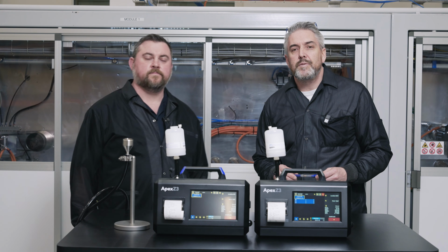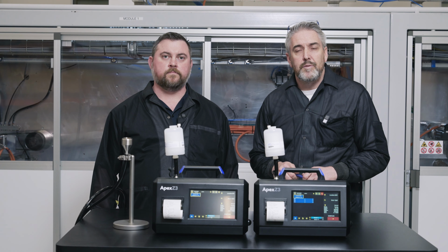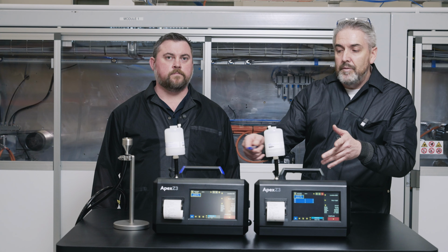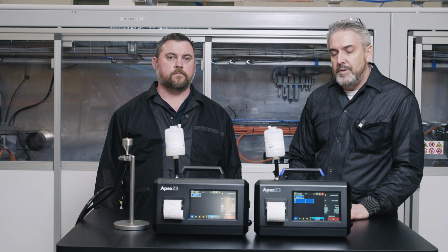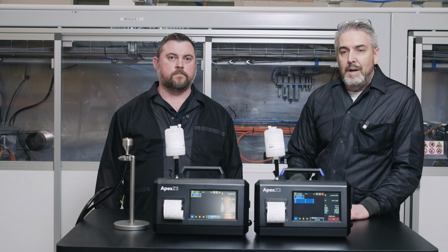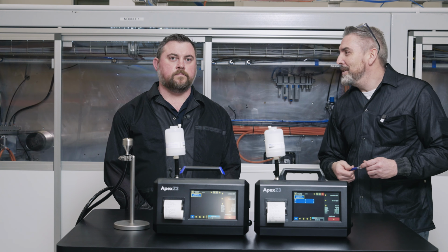David's been with Lighthouse for the last 2 years. He works in our service department for the metrology and calibration service of all of our particle counters, making sure we adhere to 17025 and ISO 21501 Part 4. And right now we are zero counting both sensors of the particle counter, so we verify that the sensors are clean before we start. David was very integral to the development of these SOPs, and David's going to start running the tests for us today. So I'd like to welcome David to our tutorial.